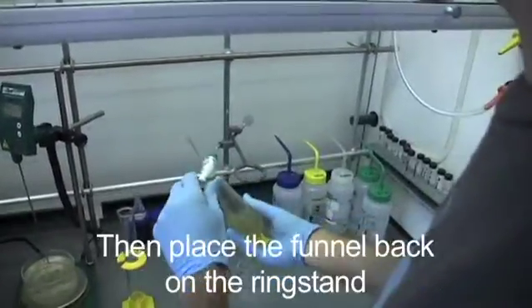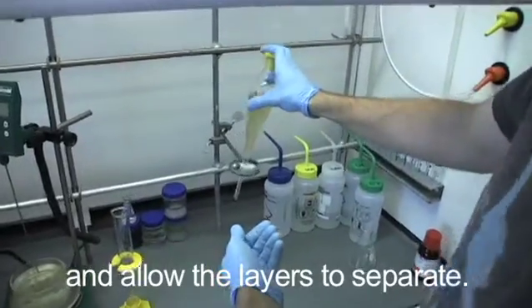Shake and vent a few times, then place the funnel back on the ring stand and allow the layers to separate.